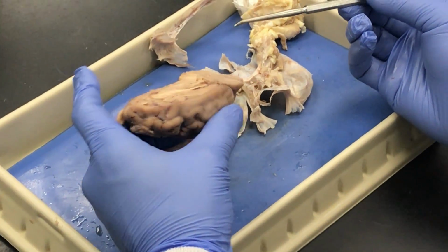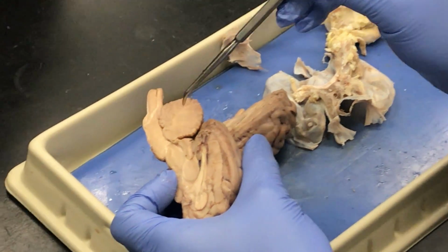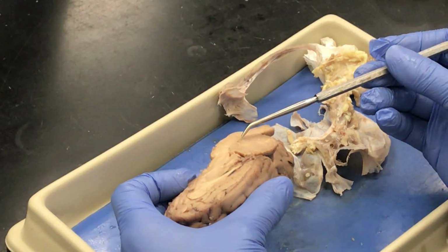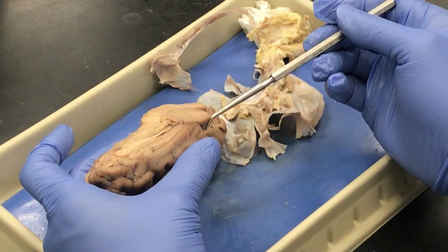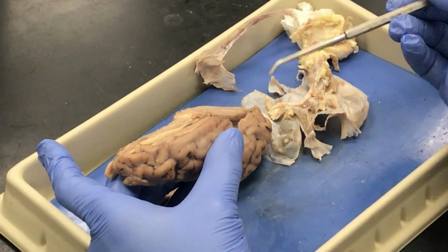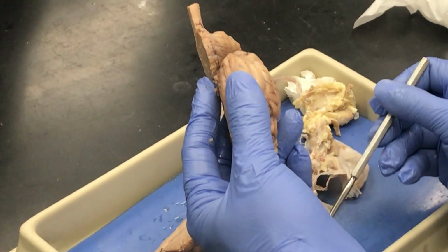Then to the cerebellum, the arbor vitae. Arbor vitae, you can see the white matter. That's truly what it is. The deep branching white matter of the cerebellum is the arbor vitae. And the neural cortex. Neural cortex would be the gray matter, either on the surface of the cerebellum or the same for the cerebrum. You could use neural cortex in either location. Superficial gray matter. And the folia. Folia are the bumps on the cerebellum.